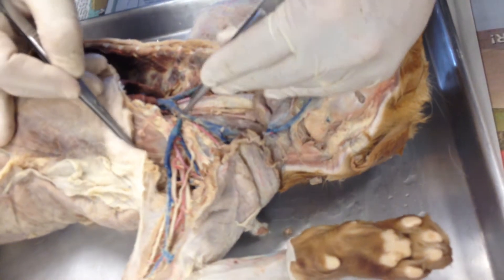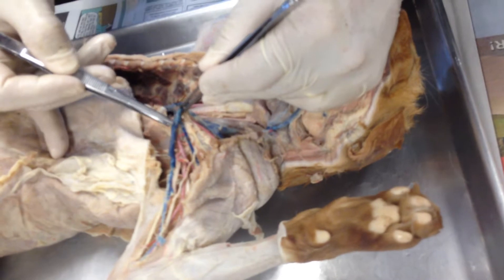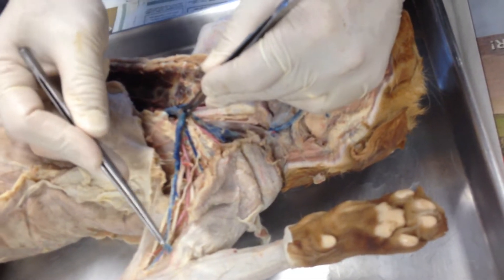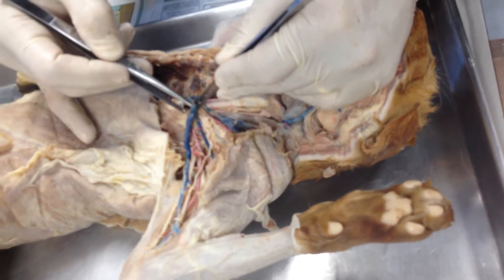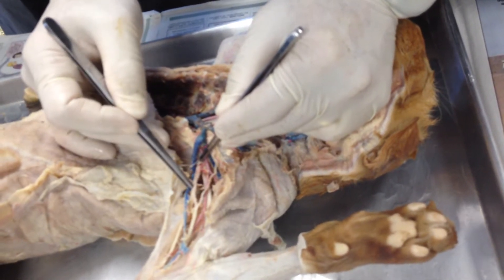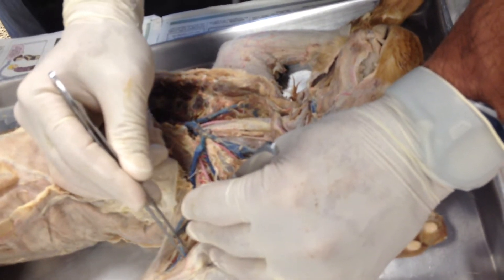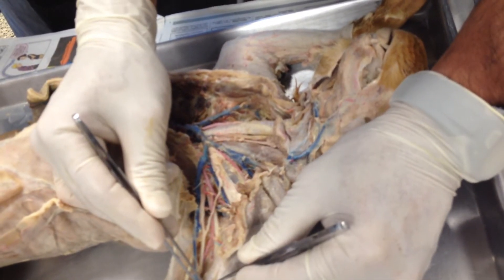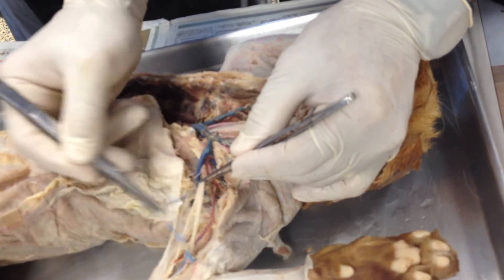There is the brachiocephalic and the subclavian right there. All of this is the same blood vessel — in the chest cavity under the clavicle it's the subclavian, in the armpit area it's the axillary, in the upper arm area it's the brachial, across the elbow and forearm it's the radial. And there is the brachial plexus — the nerve bundle. And the subscapular.